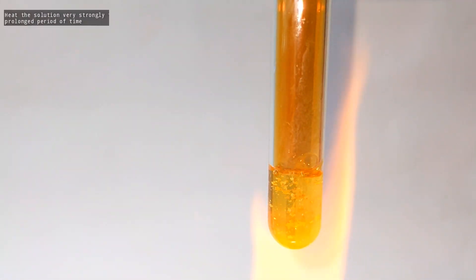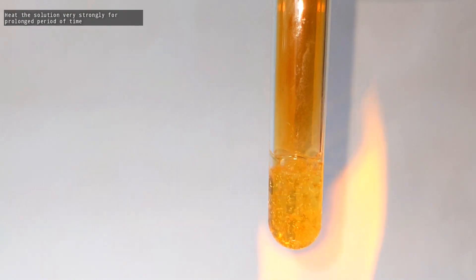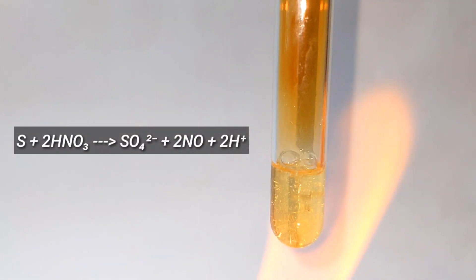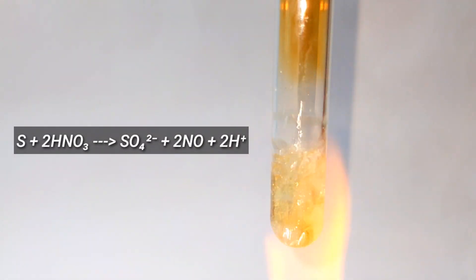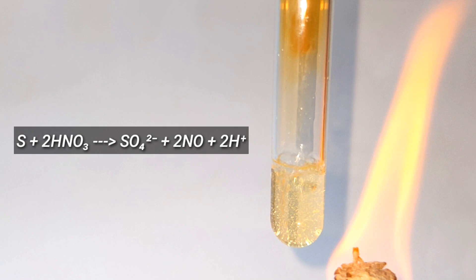If we continue heating the test tube for a considerable amount of time, the sulfur is oxidized to sulfate and the precipitate of sulfur will also disappear, giving a clear solution at last.